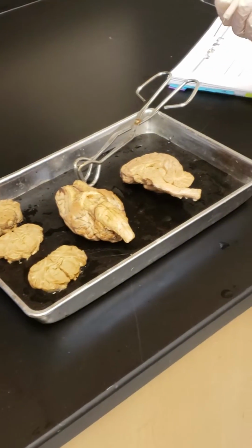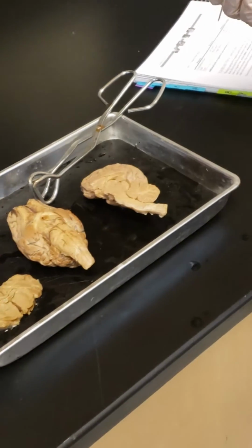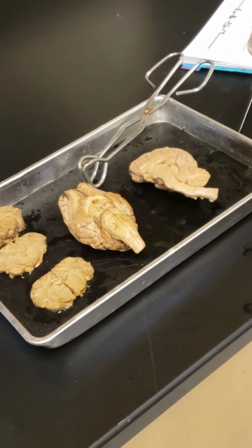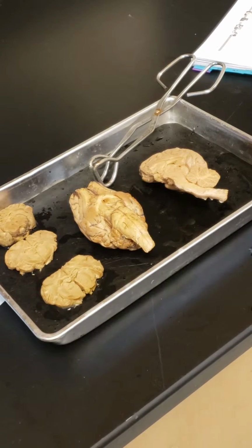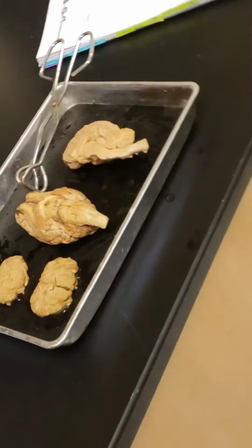What table are we looking at in the? So I'm looking on page 116 at table 11-9. And all of this stuff, the sheep brain is way more specific than the human brain. I think you won't have a problem with the human brain after we do the sheep brain.